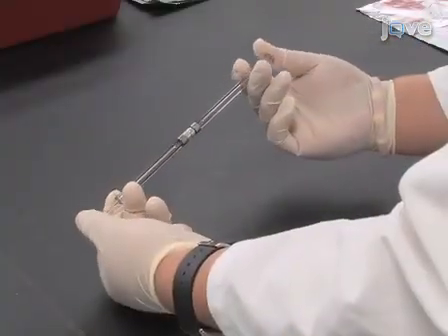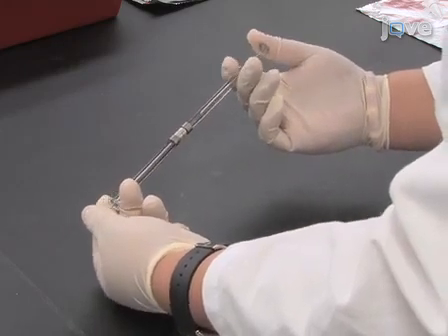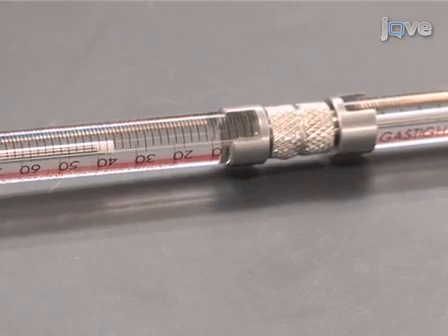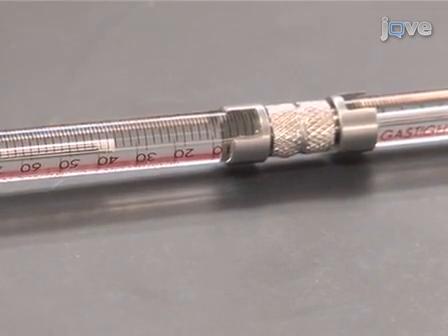Push the syringe plungers alternately to move the lipid and protein through the inner needle of the coupler back and forth until the lipid mesophase becomes homogeneous. LCP forms spontaneously upon mechanical mixing, and the protein becomes reconstituted in the lipid bilayer of LCP.